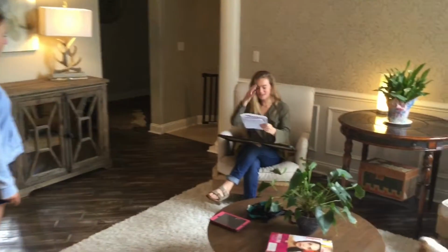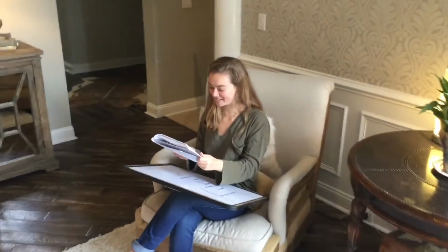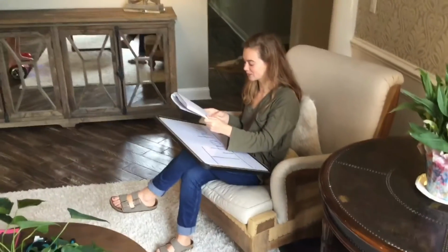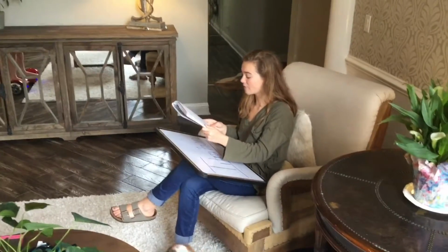Titration can be used to determine the unknown concentration by comparing the concentrations of the acid and base. Titration is the controlled addition and measurement of the amount of a solution of known concentration required to react completely with the measured amount of a solution of the unknown concentration.